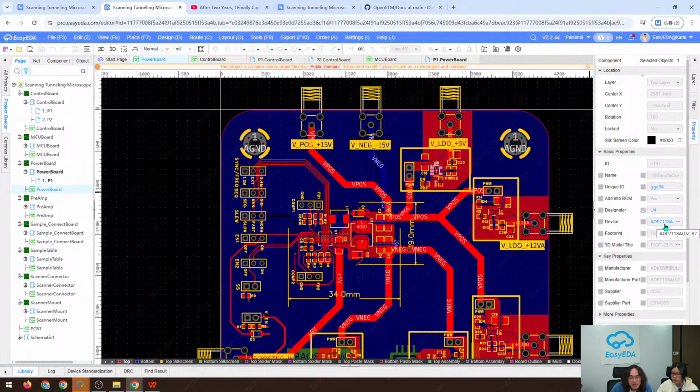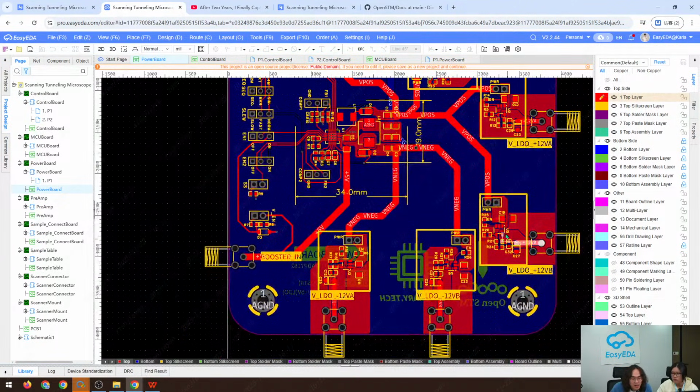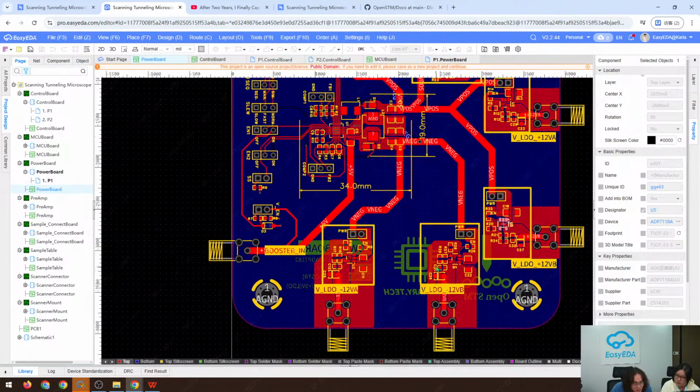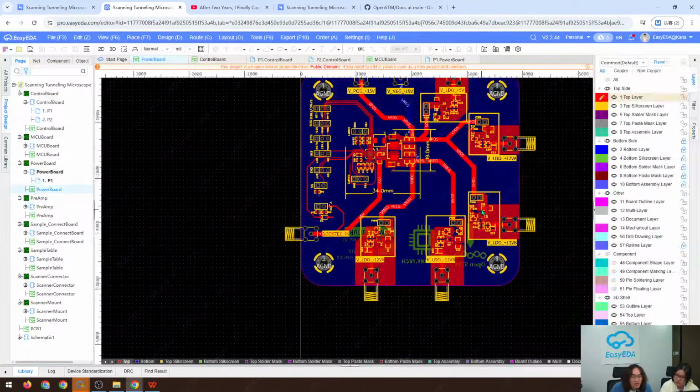In this case, I use the ADP7118 for the positive voltage. Sorry, this is the positive one. The negative one is the ADP7182 for the negative voltage.